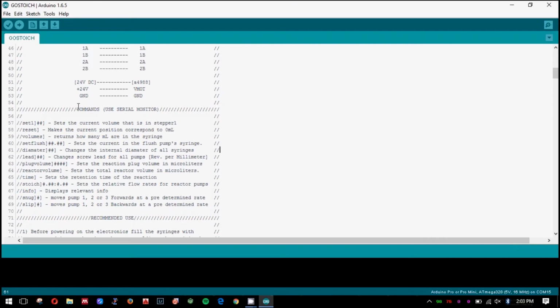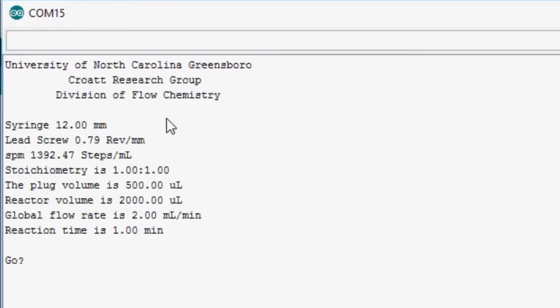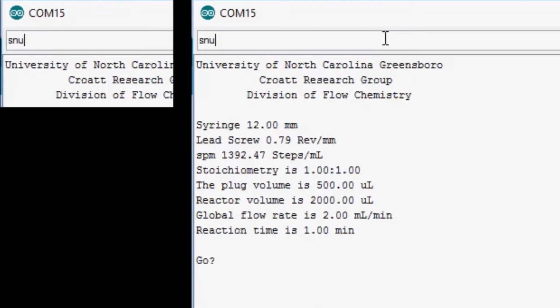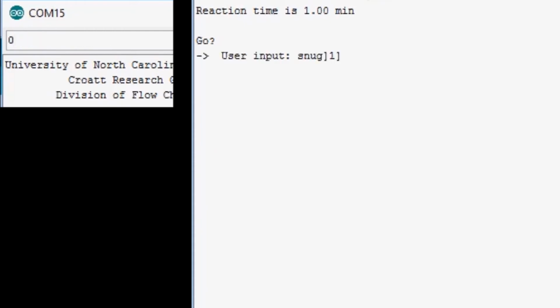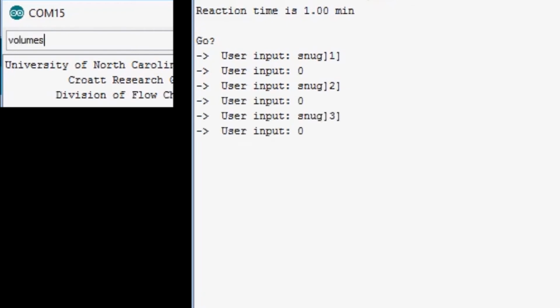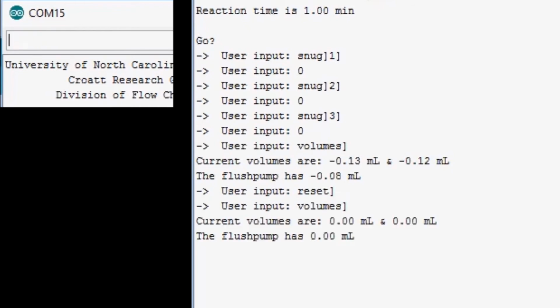Let me show you how a typical experiment is conducted. Open the serial monitor, and after the splash screen is displayed, you can fill the syringes with reagents and use the snug command to adjust the slack in the syringe pumps. Typing in 0 and pressing enter will stop any active command. Using the volumes command, you can see that now the microcontroller thinks there is a negative volume in the syringes. Let's correct that by using the reset command. Use volumes to verify that volumes has been reset to 0. Alternatively, you can proceed to inform the correct volume of the reagents in the syringes by using the set commands.